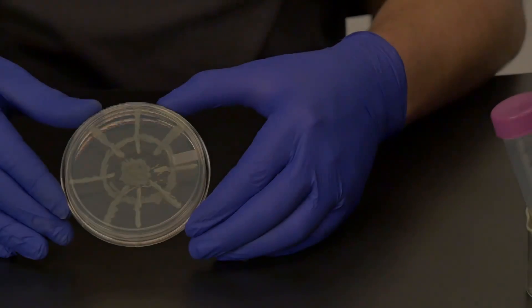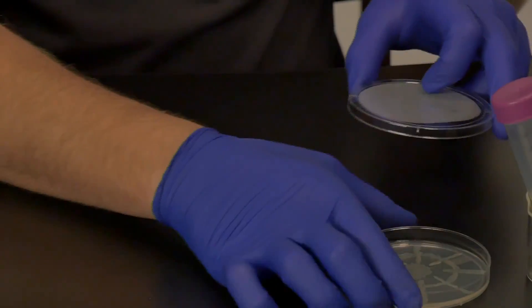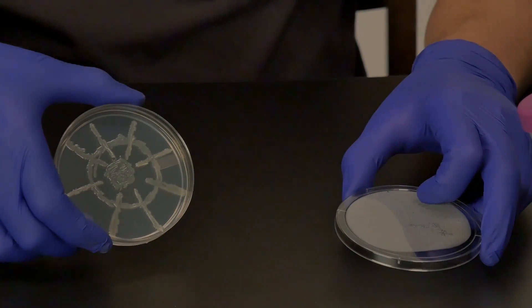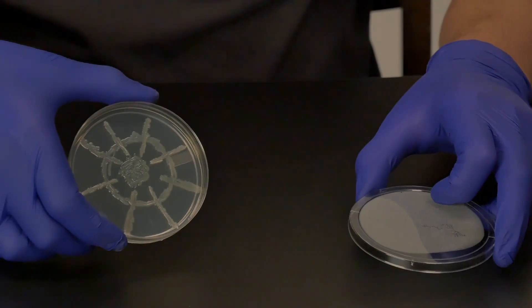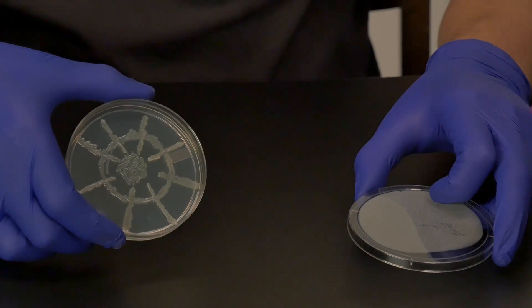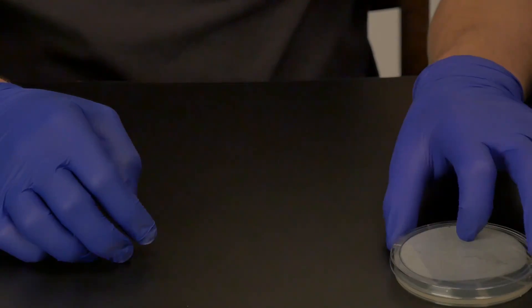The third method is named wagon wheel. It will have the pathogen as the hub of the wagon wheel with the samples radiating away as spokes. Obtain a sterile petri plate that contains the same media that you previously used to show a zone of inhibition. Take some sterile toothpicks, swabs, your master plate, and the positive control. Label your new plate with your name, today's date, media type, and the incubation temperature.